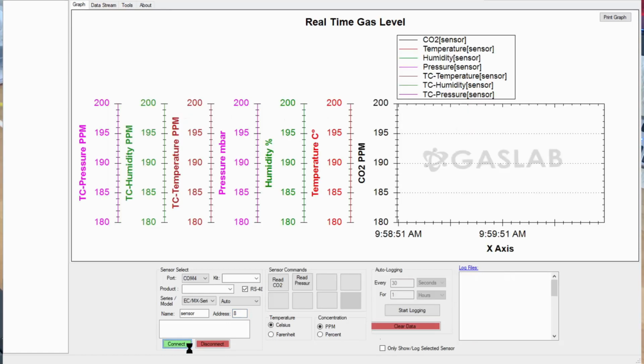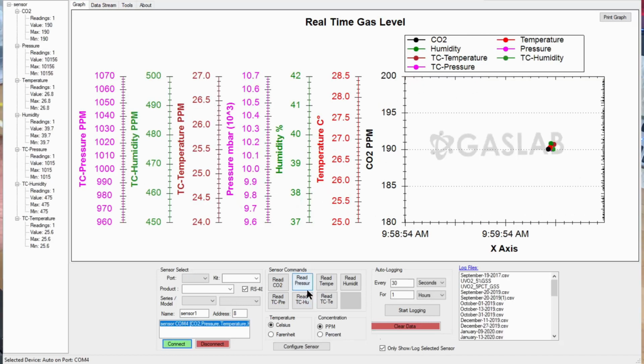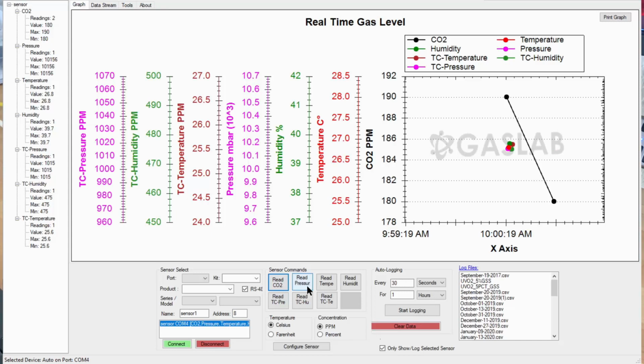And you can see we've got our CO2 and the rest of the sensors associated with this, because this also has extra sensors in the tube cap itself for pressure, temperature, and relative humidity, so that you can do altitude or pressure compensation, for example, when you would be using a pump. So that's what this little connection there is about. All right, so it's connected, we're making readings and that good stuff.